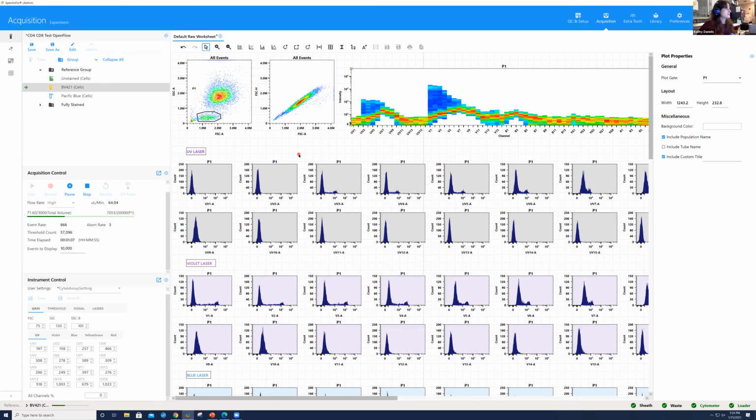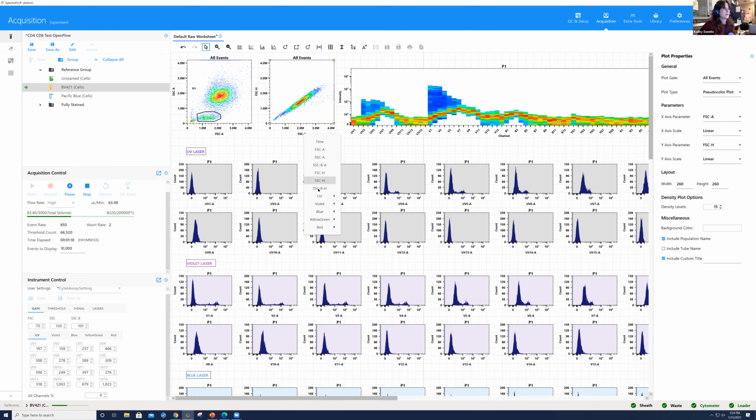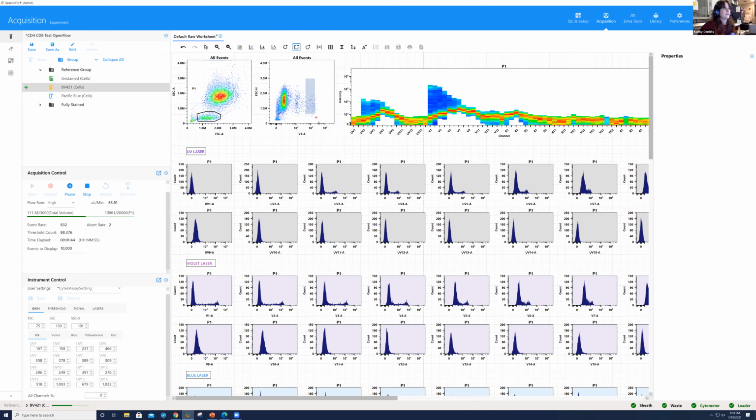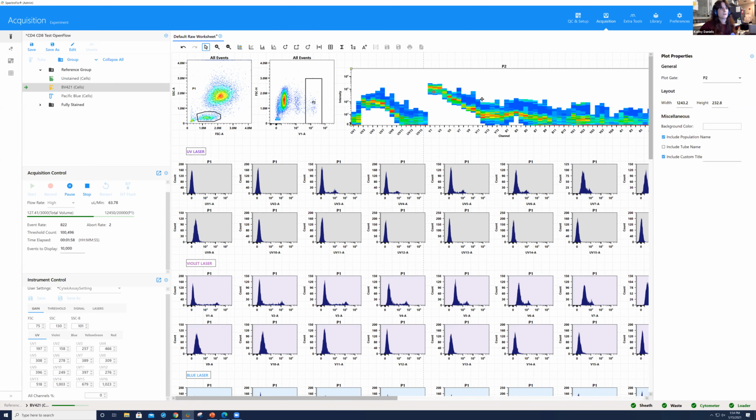So we have two options here. If I want to see specifically the BV421 signature to check it, I can right click on this axis here on the second plot, and I can choose one of the detectors that I know has BV421, or is going to show that signal. So it's brightest around V1, V2. If I click on that, we're able to see the BV421 positive. If I then click on a gate here, I can go ahead and choose our 421 positive. And then if I click on the full spectrum plot, what I do have the capability of doing is changing the plot gate. So I'm visualizing P2, and this will show me that signature.